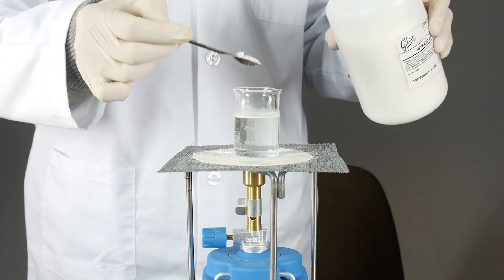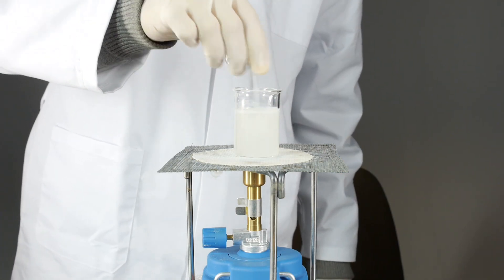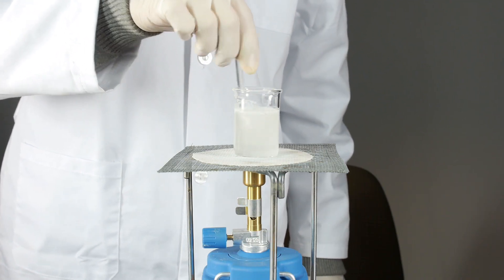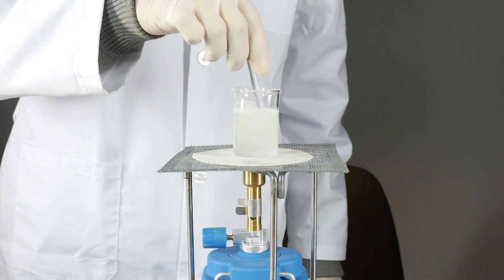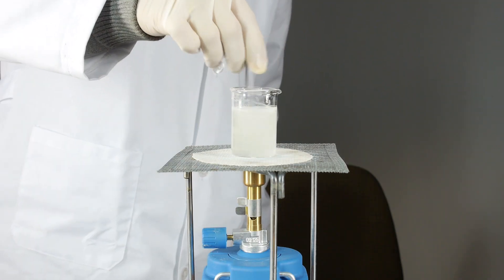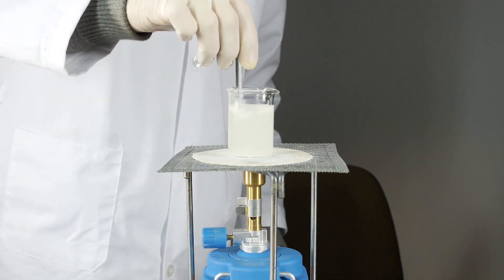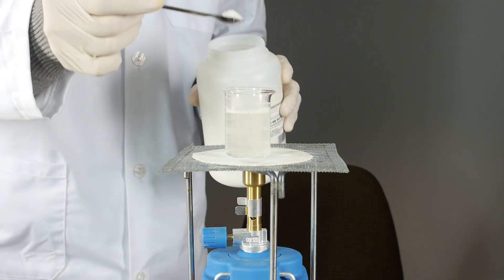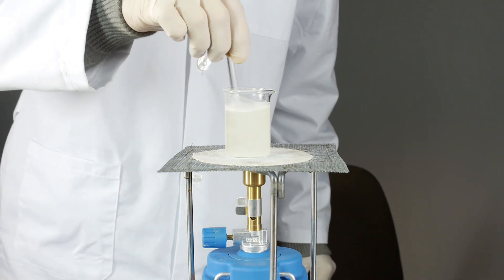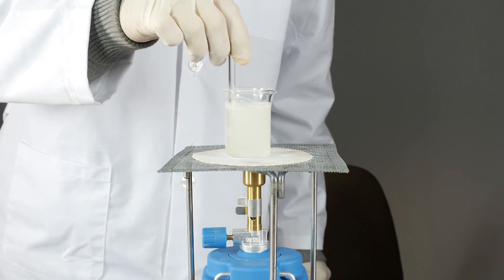It seems that it all has dissolved, so more solute. Potassium nitrate is mainly used as a fertilizer. A little more — it seems it wants more, still more. As you can see, the solubility of potassium nitrate in water, when we are almost at 100 degrees Celsius, is very very high.